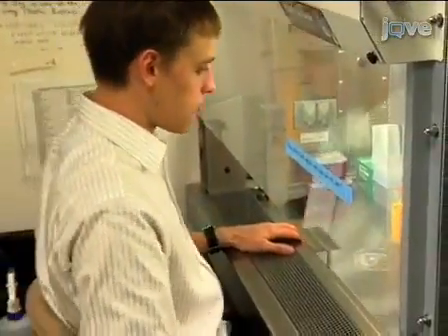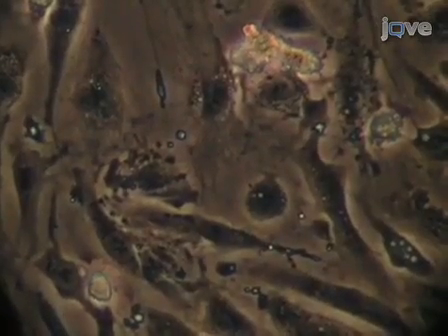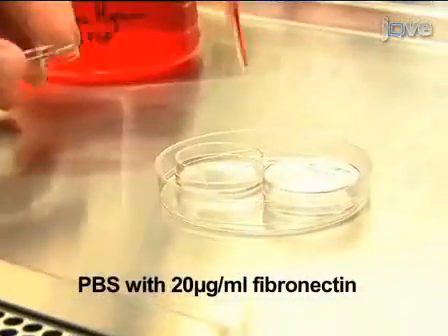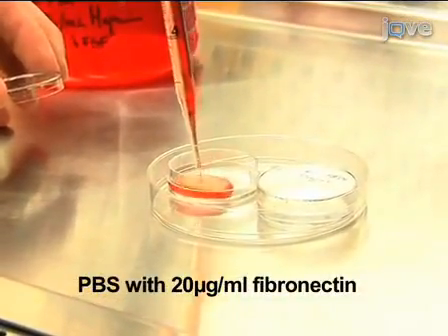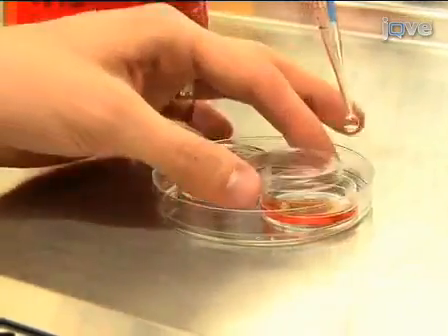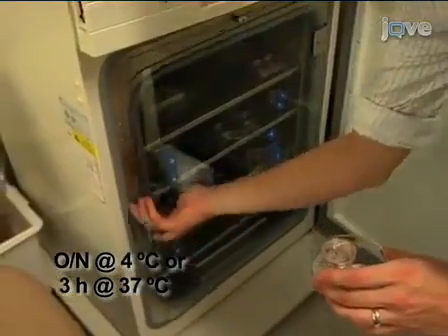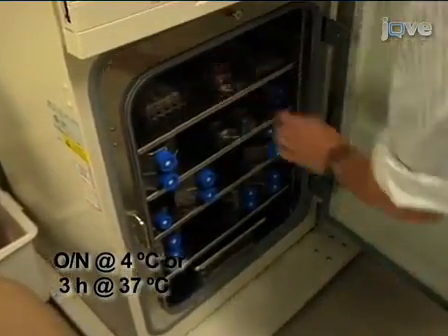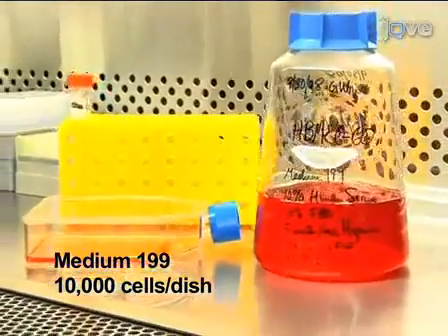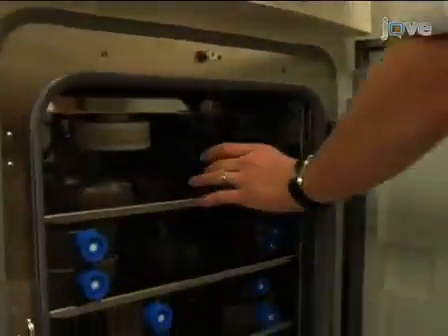The first step in this procedure is preparing the endothelial cells that will line the flow chamber. This protocol uses HbMEC60 cells derived from human bone marrow microvasculature. Culture dishes should be pre-coated with fibronectin. To prepare these, incubate 35 millimeter tissue culture dishes with PBS containing 20 micrograms per ml of fibronectin. These may be incubated overnight at 4 degrees Celsius or for 3 hours at 37 degrees Celsius. Suspend HbMEC60 cells in medium 199 and seed at 10 to the 5th cells per dish. Grow the cultures to over 90% confluence. This will take about 2 days.